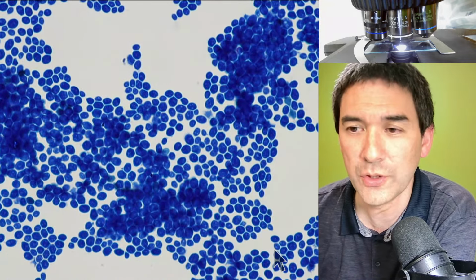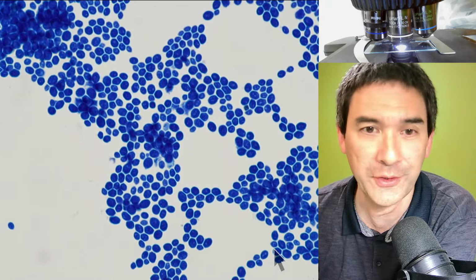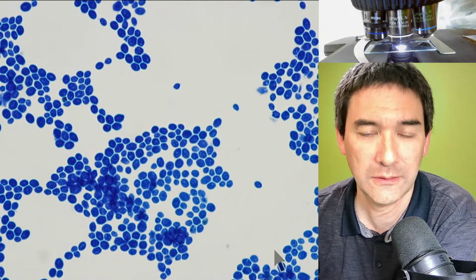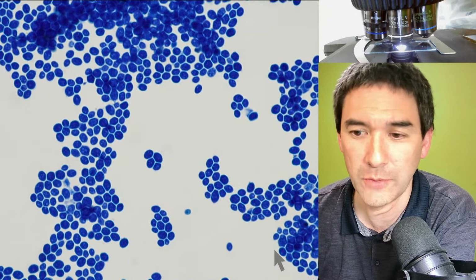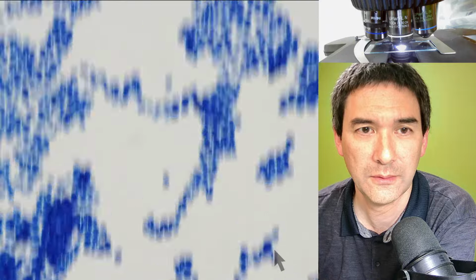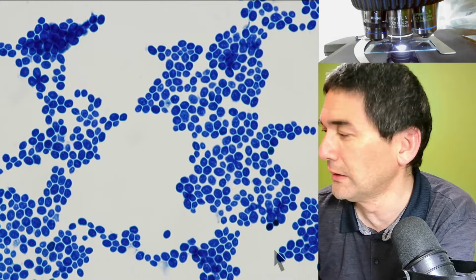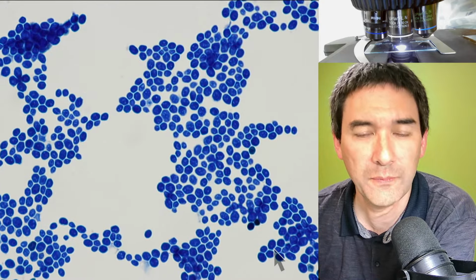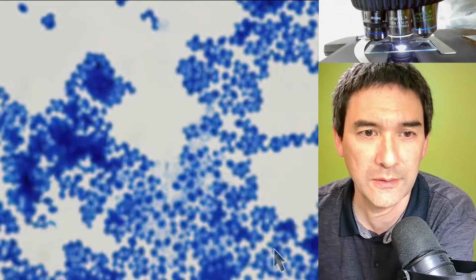I'm just reading: is heat fixing also possible with a coffee warmer? No, it's not hot enough. You can try it, but generally it's got to be much hotter. So this is simply to show you a little bit that essentially you do not need a cover glass for oil immersion microscopy.